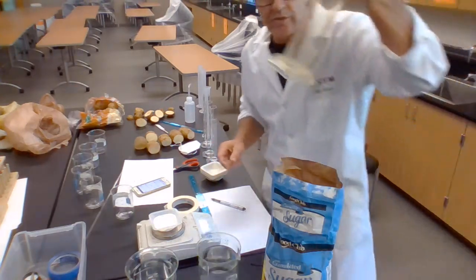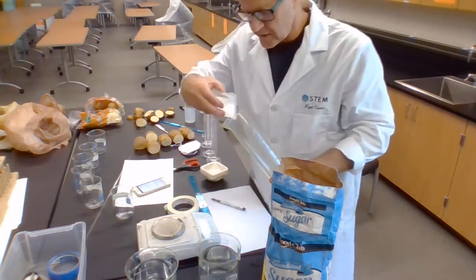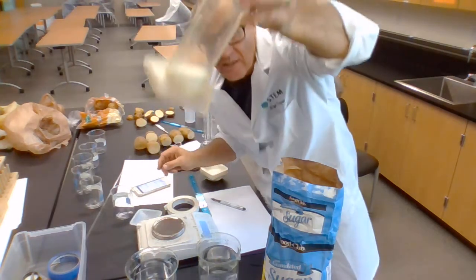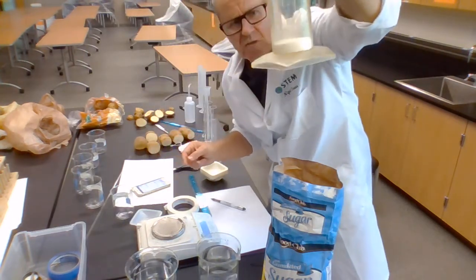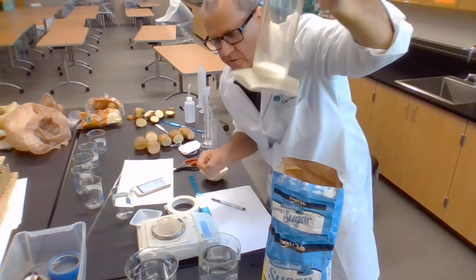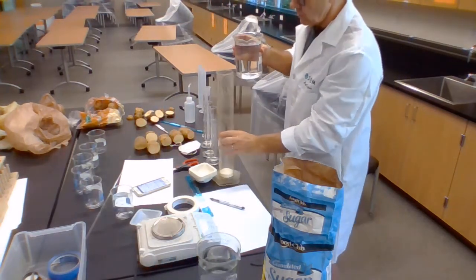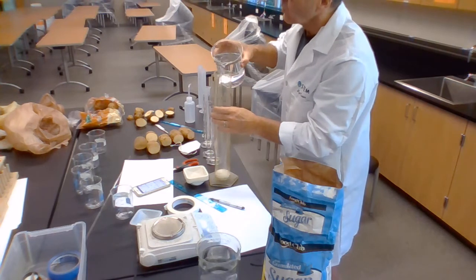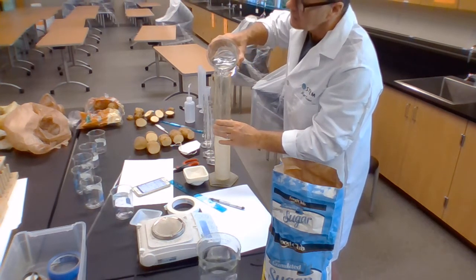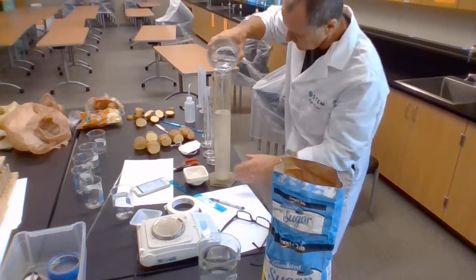Now what I do with that is I place it in this 1 litre measuring cylinder very carefully so I don't drop any on the floor. And there it is, at the bottom of the measuring cylinder. You can see it's quite a lot. Imagine if it was 10 times that, 1 mole of sucrose. Really hard to get it to dissolve. And now I fill this up to the 1 litre mark. And 1/10 of a mole in 1 litre is a 0.1 molar solution.